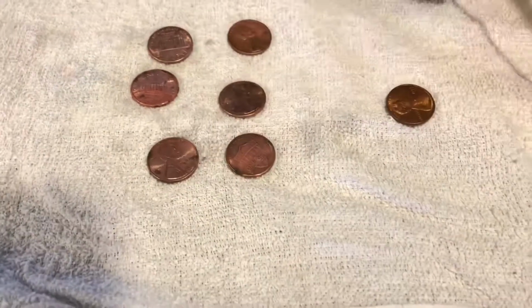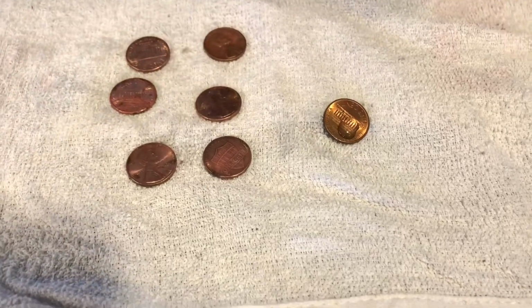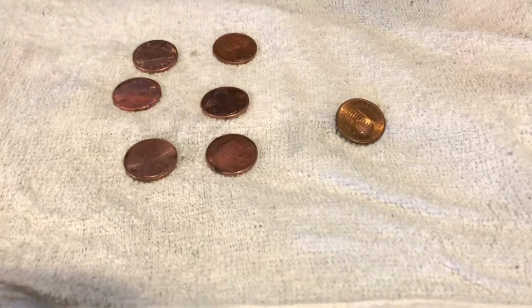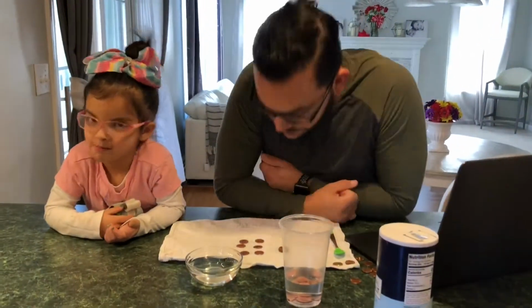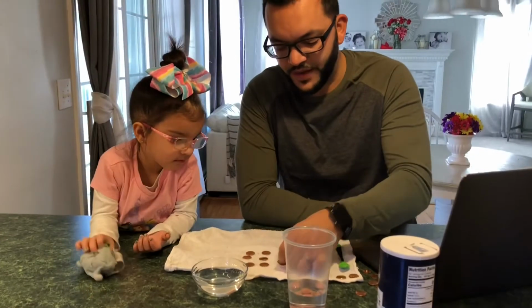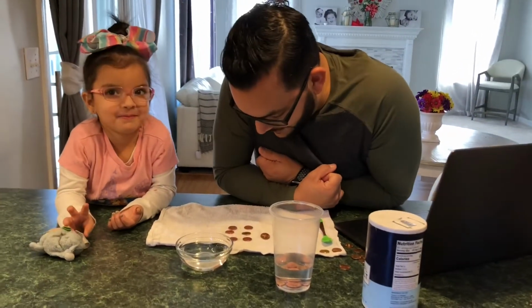It might take longer than normal. This isn't happening as fast as it did in some of the other videos that we looked at. But I think it's slowly happening.